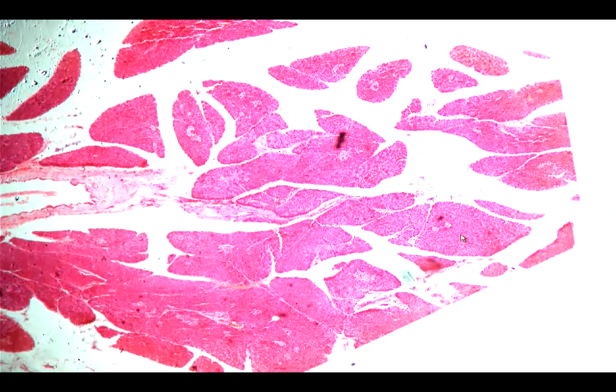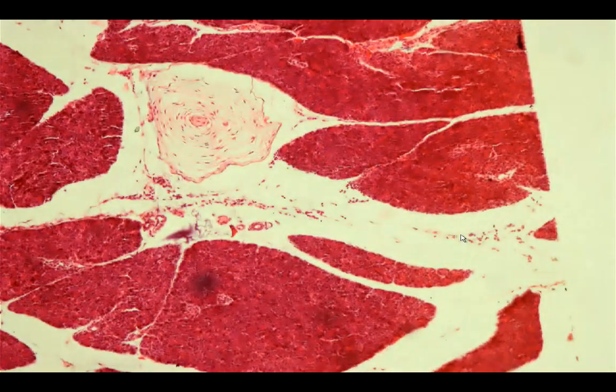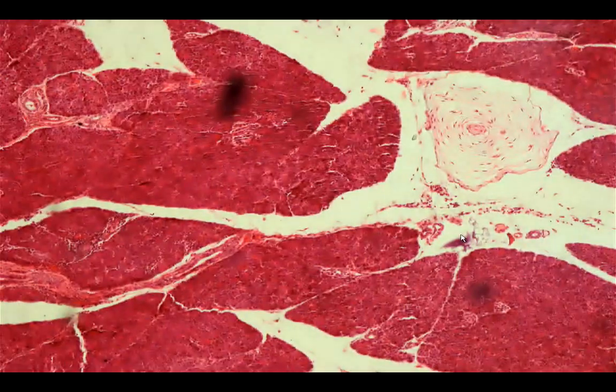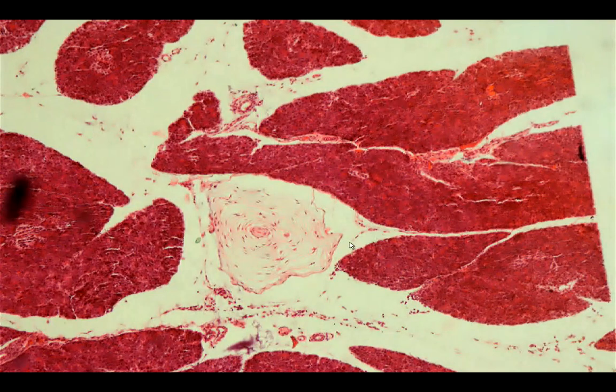Next, we go to the Pacinian corpuscle. Okay, take note of the spelling. So for the Pacinian corpuscle, it can be situated in the skin. It can be situated in the deeper portions, like in this organ. This is already a pancreatic tissue. This is a Pacinian corpuscle. And a Pacinian corpuscle is a sensory receptor. It is a sensory receptor for pressure and vibration sense.